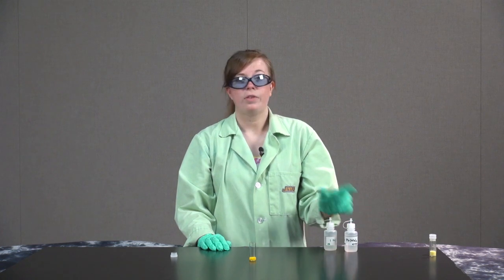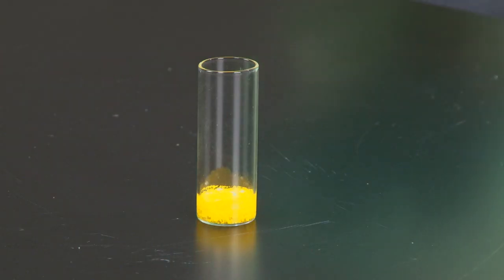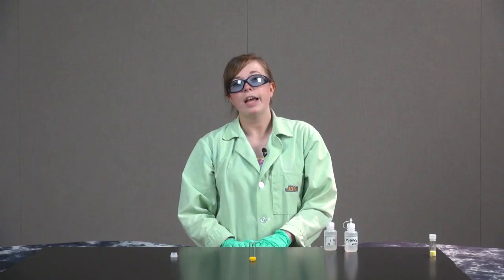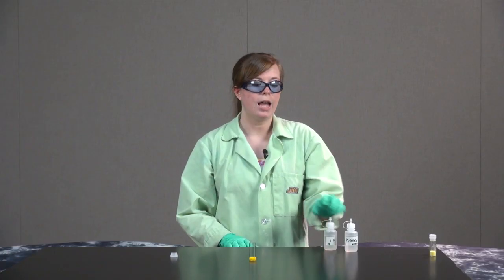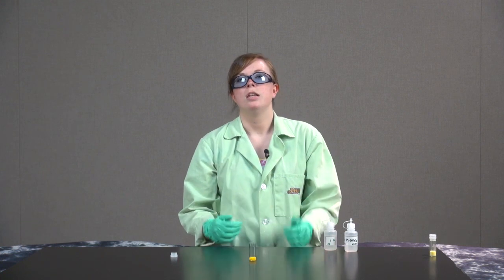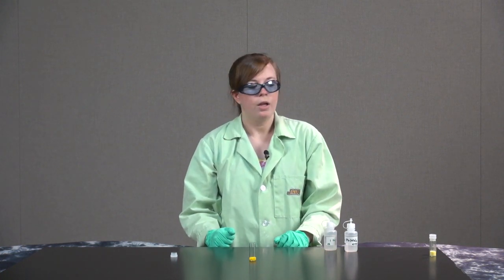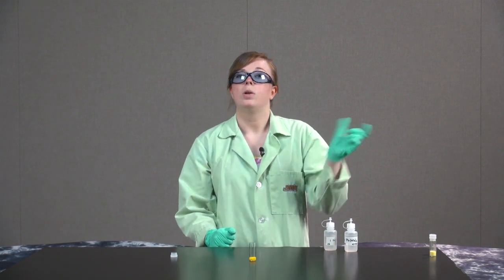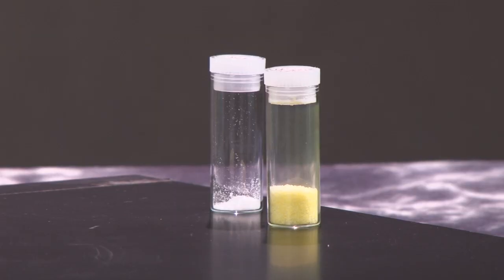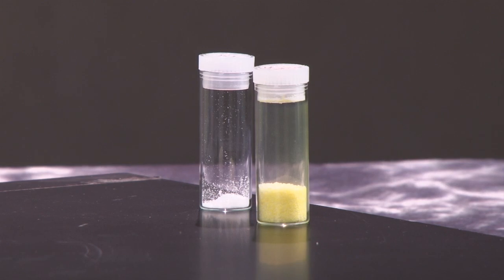The solid phase reaction took longer and required an input of energy. In general, aqueous reactions tend to occur faster than solid phase reactions because the ions are mobile and free-flowing in solution, thus it's easier for them to react. The solid phase reaction could only happen as the solid particles of lead nitrate and potassium iodide rubbed against each other.